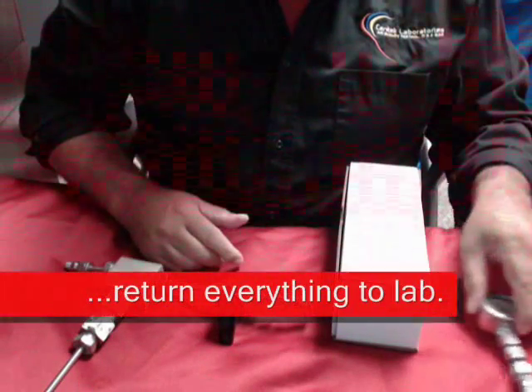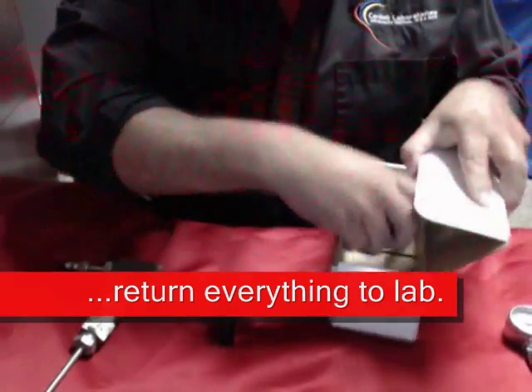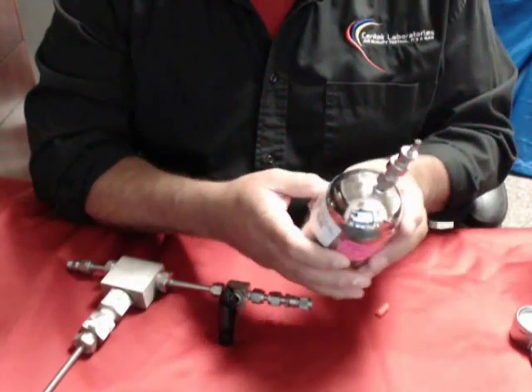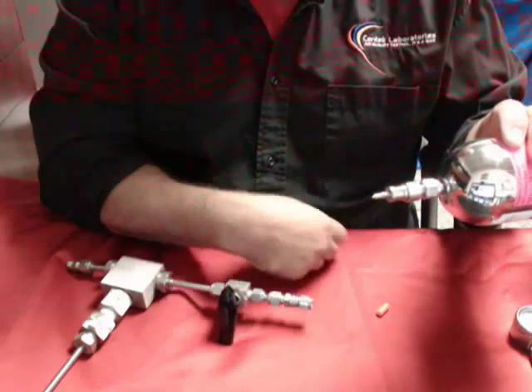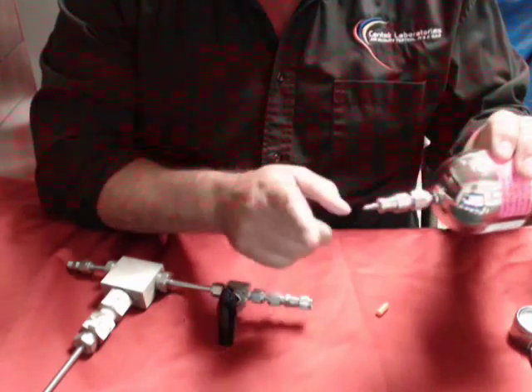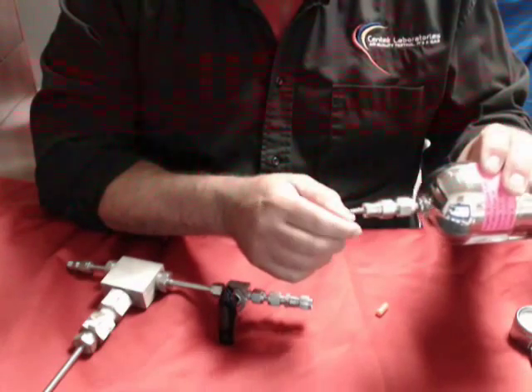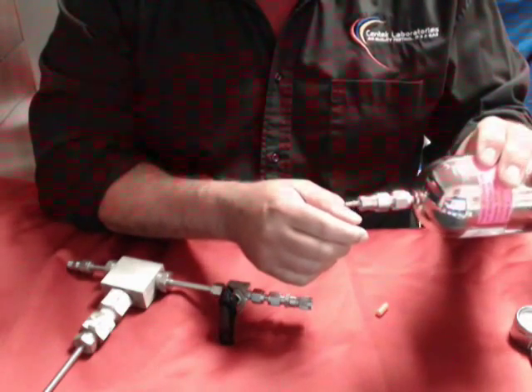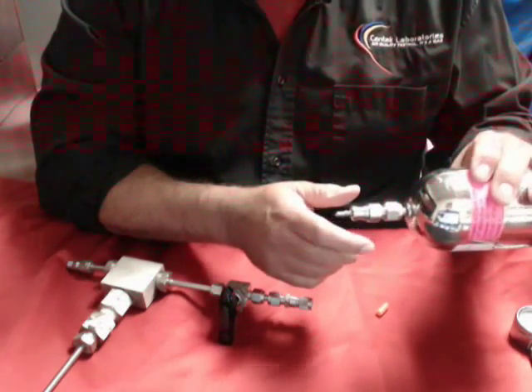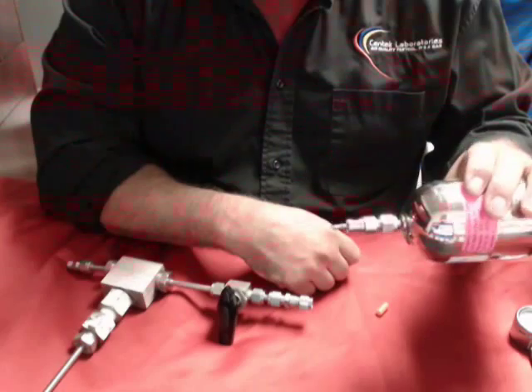Now some of you may lose the orange cap — it's not that big of a deal. However, you have to remember that because the crosshairs are on here, if it goes into the box and during shipping it starts bouncing around, these crosshairs are going to become engaged, and because it's under positive pressure, it will push small amounts of gas into the box. It could bias your results, and for shipping purposes, it's going to make the shipping carrier upset because his truck now smells of biogas.